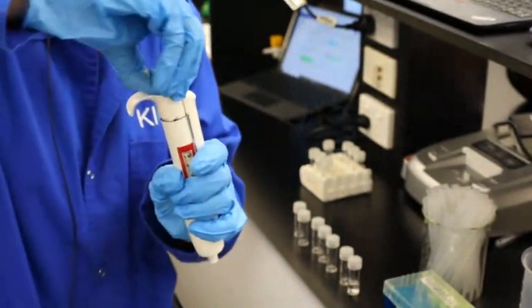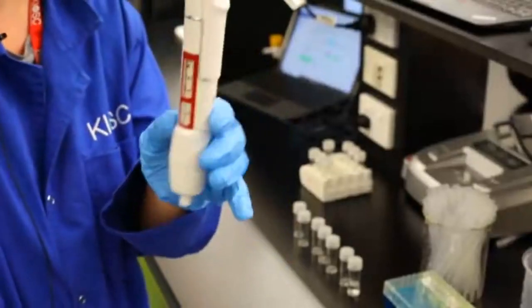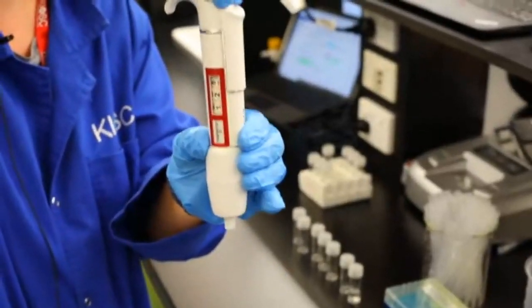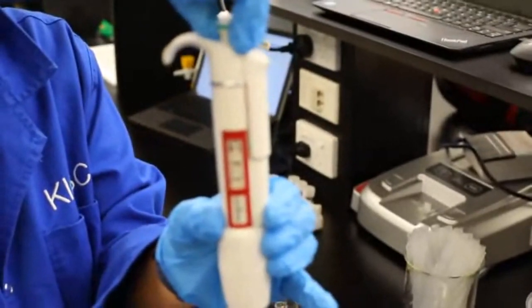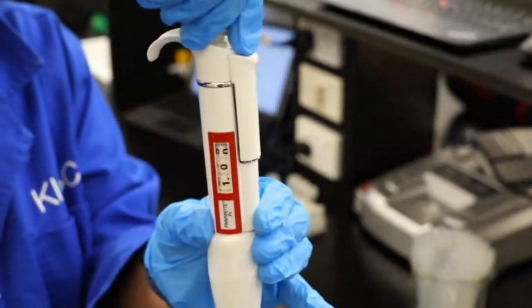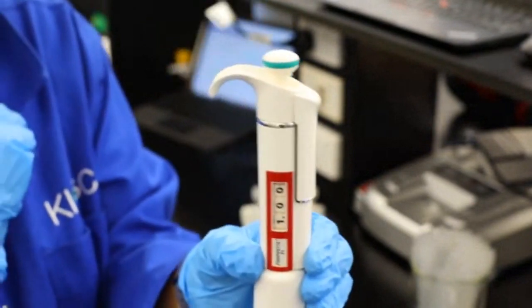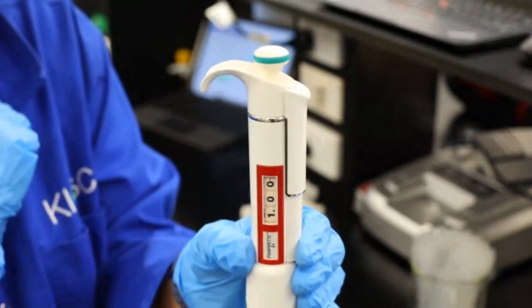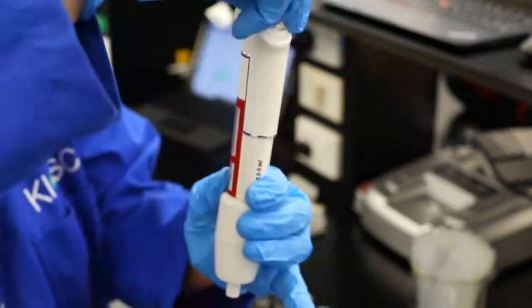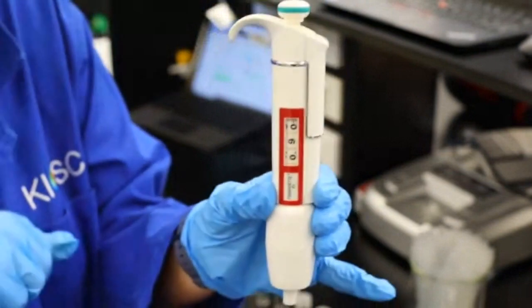The other thing is at the top of the knob here, you pull this up, and this is how you can control the amount that you have in there. I'm just going to let Alex zoom in so we can see it. There we go. So you can see we can zoom around and make it whatever amount we want. In this case, I'm going to be doing a blank, and I need to make it 900, not 100. So we're going to be putting in our 900 microliters.